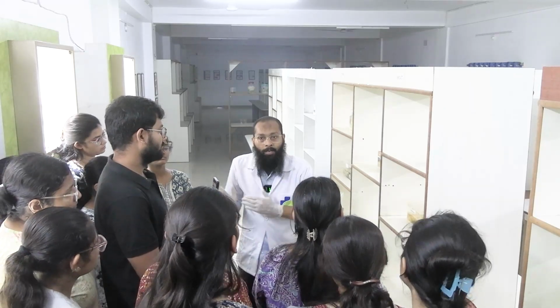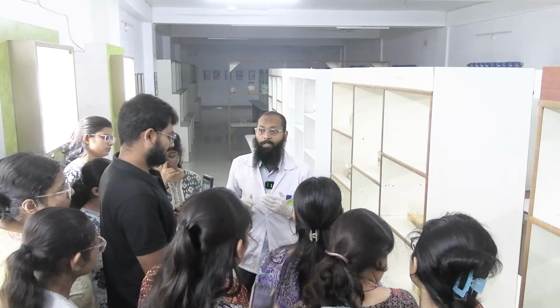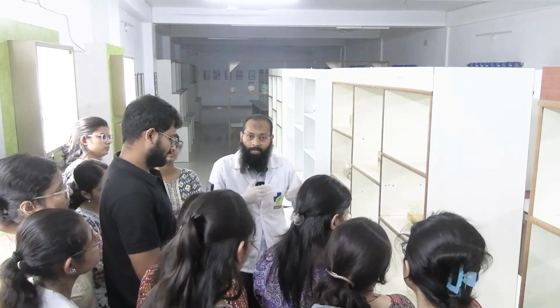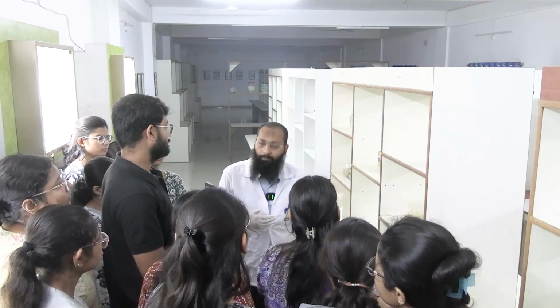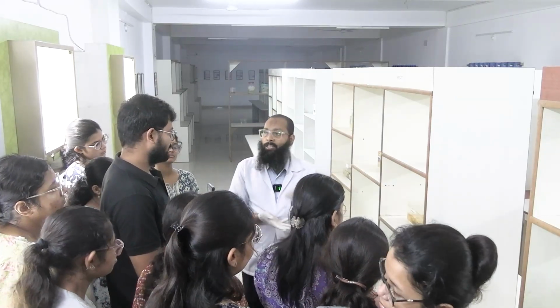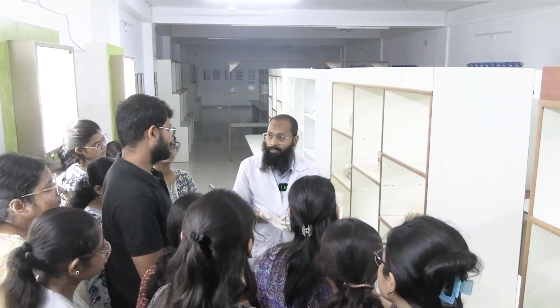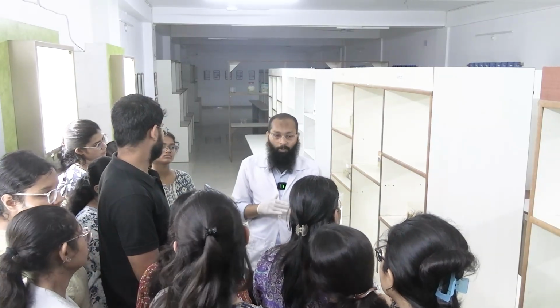Before operation many things are done in the patient, like USG breast and mammography. We go for those reports to see in which side the lesion was present, whether left side, right side or both.